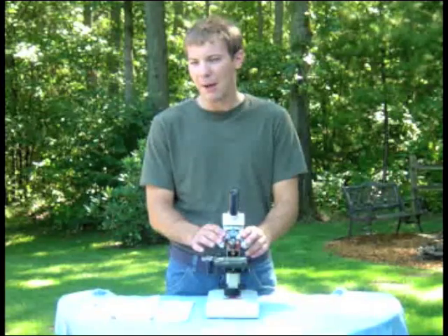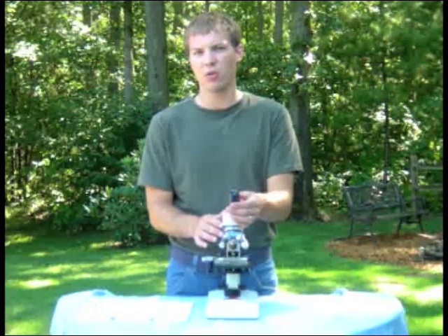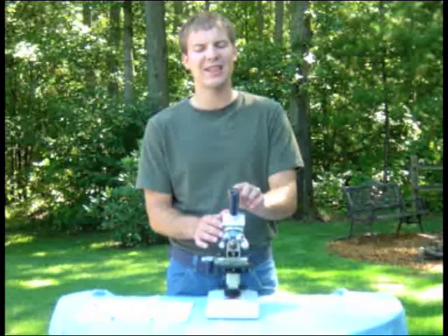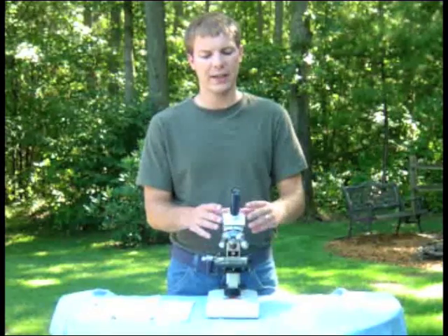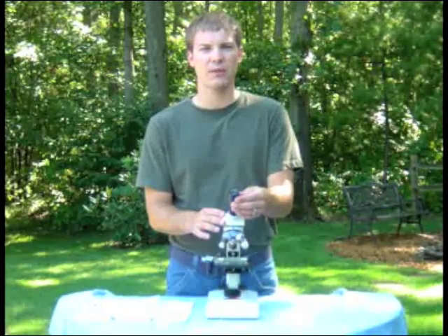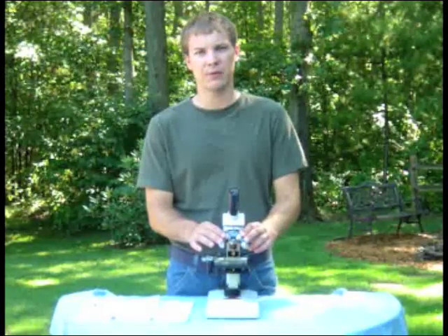The compound part comes in because the eyepiece that you look through also magnifies the image. And if you look on the eyepiece, you'll notice it says 10X. So the reason this is called a compound microscope is you're multiplying the magnification of the eyepiece by the magnification of the objective lens.